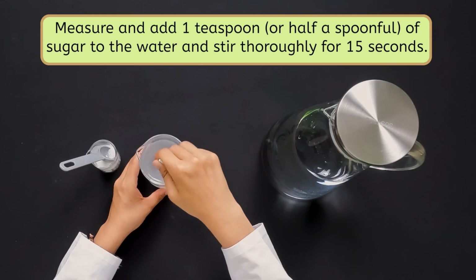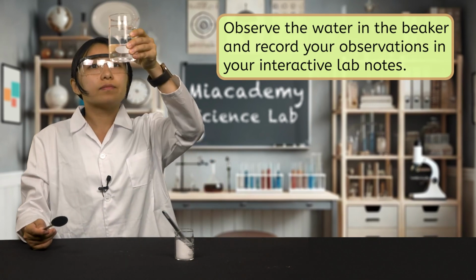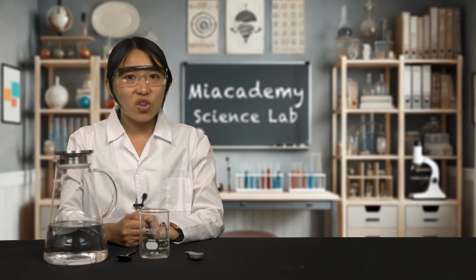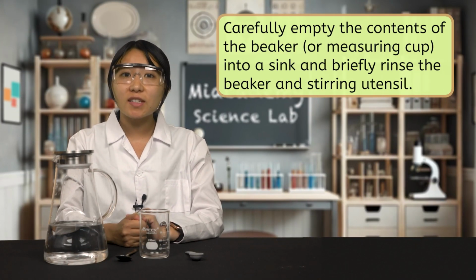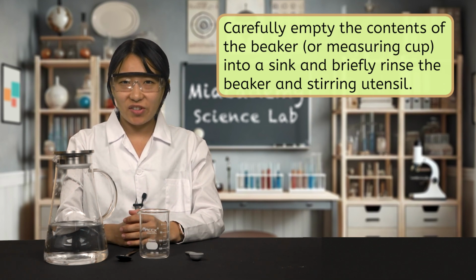Observe the water in the beaker. Did all of the sugar dissolve? Pause and record your observations in your interactive lab notes. Before beginning the next trial, make sure to carefully empty the contents of the beaker into a sink and rinse the beaker and your stirring utensil.